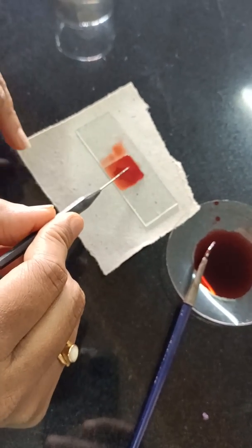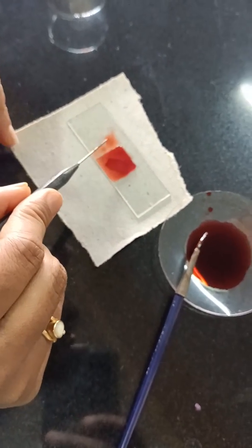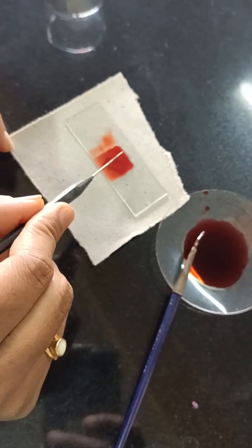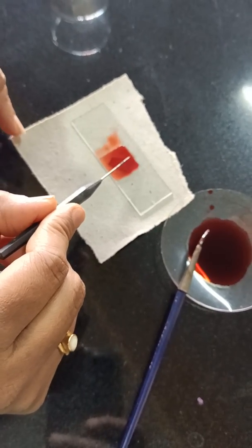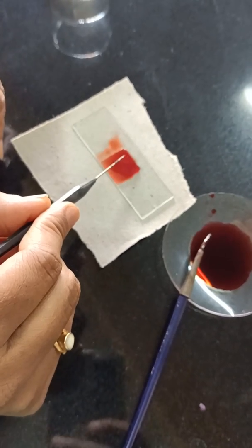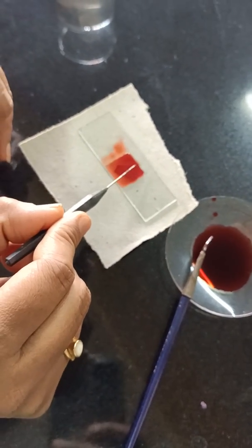This is how you need to follow the procedure for all three options for question number 1, which is preparation A. I hope your doubts are cleared now. This is how nuclear staining is done — the nucleus picks up the stain and the rectangular shaped cells appear in this way.